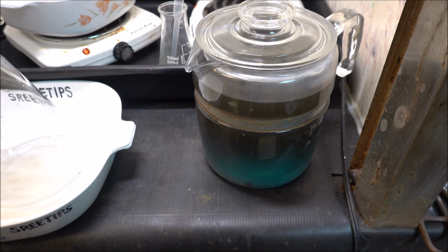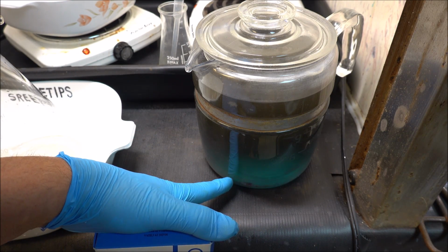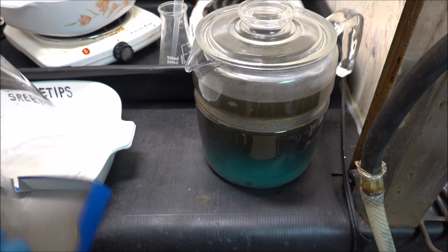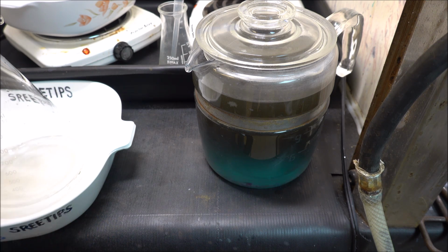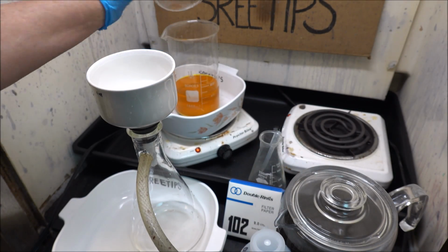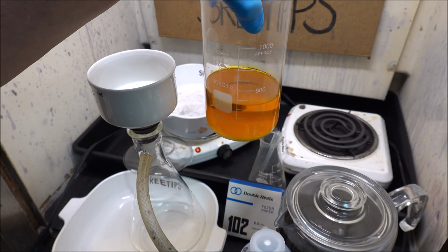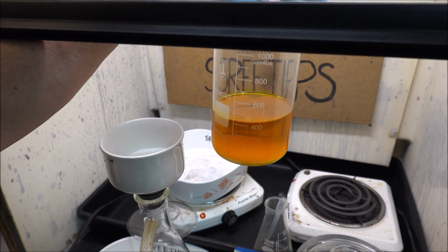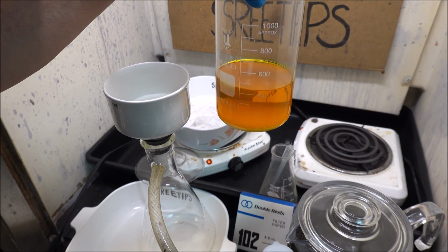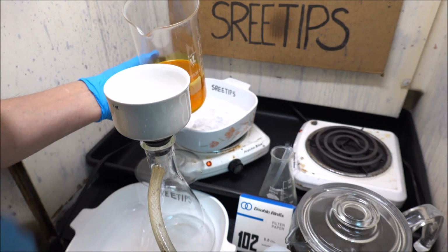All right, if you look here, you'll notice that the suspended gold is floating on top of the solution. Down here it's clear blue, which is kind of an unusual phenomenon, as we get set up here to filter our gold solution. Now I'll take our gold solution back here that's been cooled off all night. See how clear it is? All the material on the bottom there is mostly filter paper. So now we're going to pour it through this filter and filter all the solids out of this gold solution.